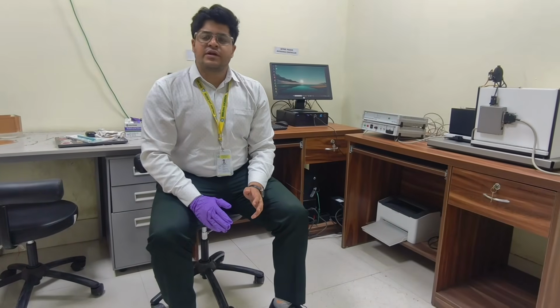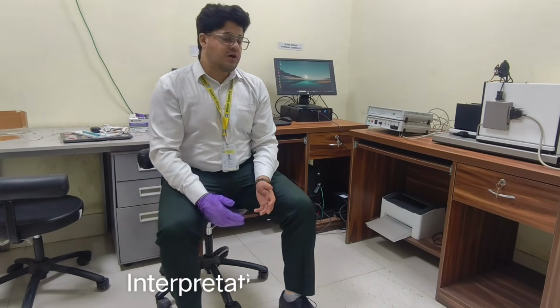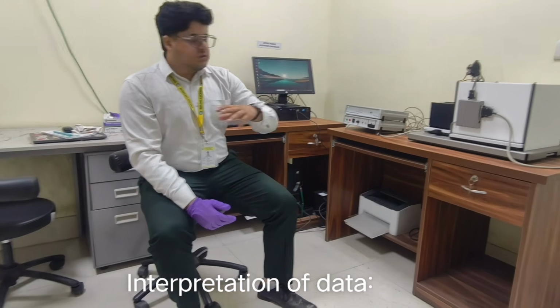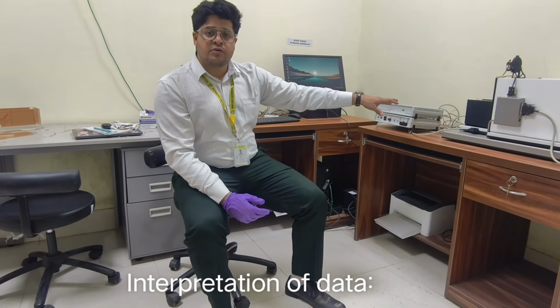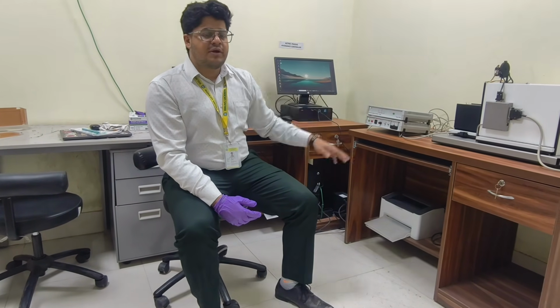So we know that rodents naturally prefer moving towards the darker environment. Before the stimulus started, when the rat was placed in the light environment, after some exploration time he naturally went towards the darker area, the dark box.